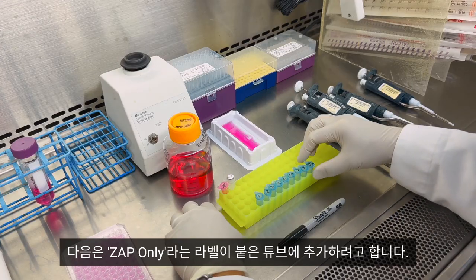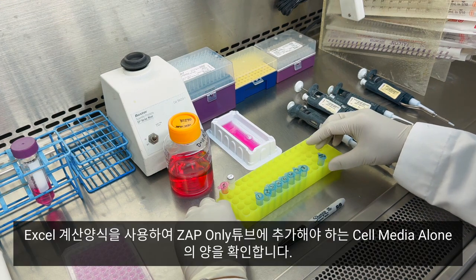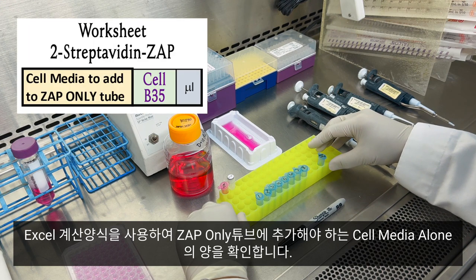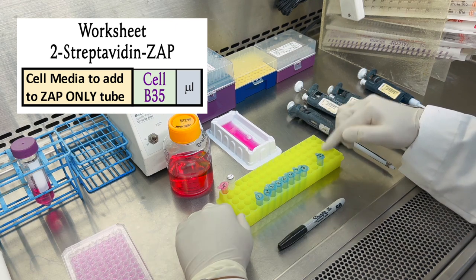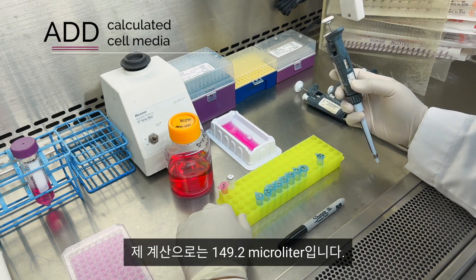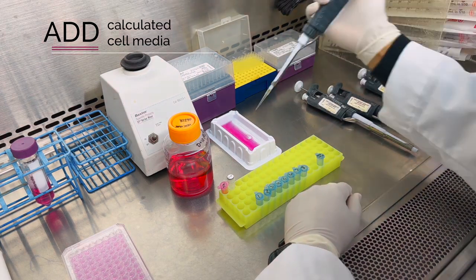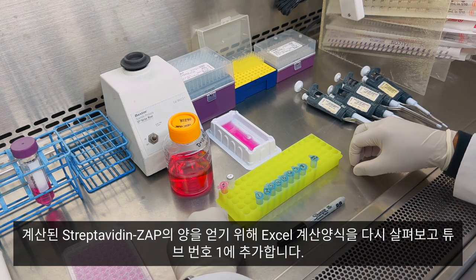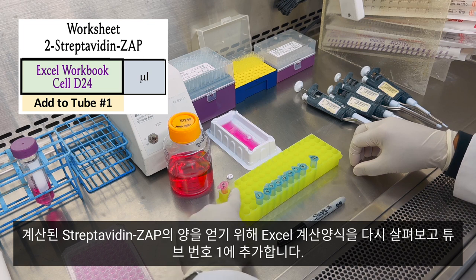Next we'll add to the tube labeled zap only. Use the calculations from the Excel workbook and look at the volume of cell media alone that we need to add to the zap only tube. In my calculation it was 149.2 microliters. Look again at the Excel workbook to get the amount of streptavidin-ZAP that was calculated and added to tube number one.